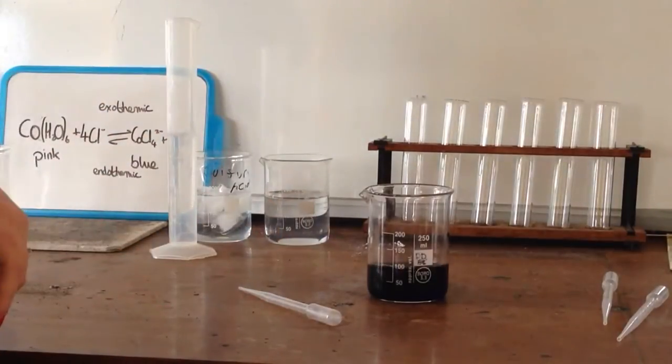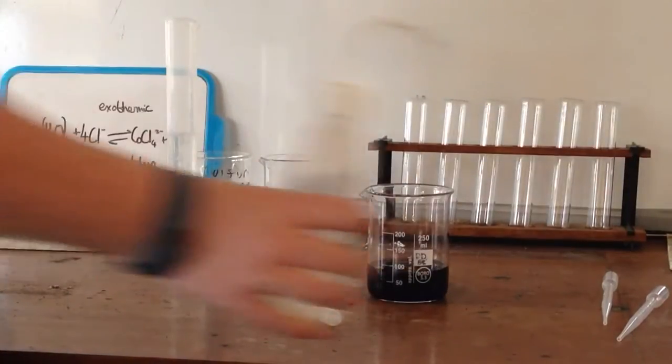So I'm just going to pour this into some beakers up here.